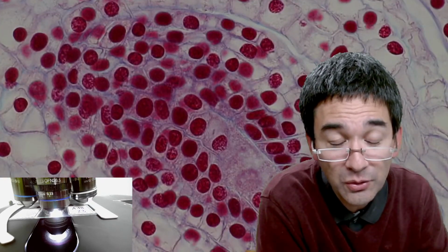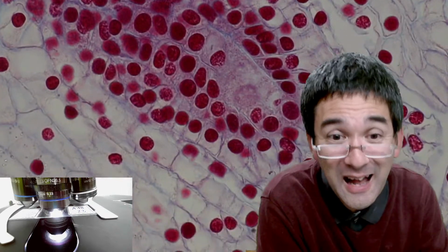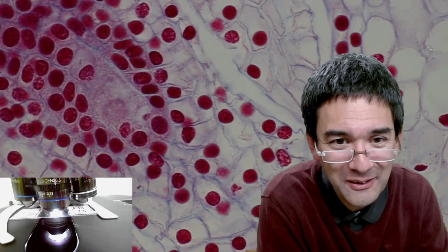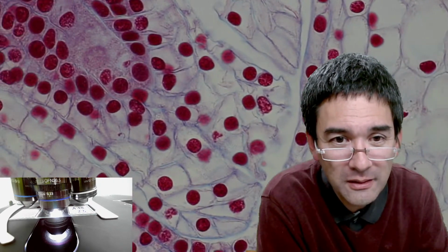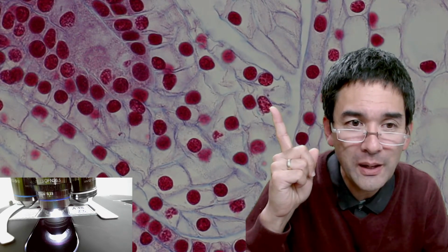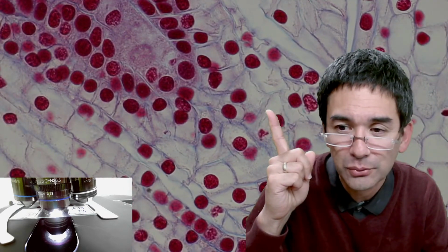So if you want to see the cell division a little bit, you have to watch the video after it is finished, and YouTube will put it online, and then you can catch up on all of the things that you missed. Yeah. So again, here you see that some of the nuclei are not quite as dense, and this means that the cell is in prophase.